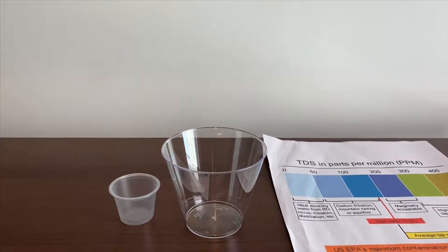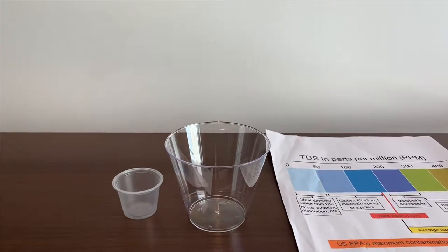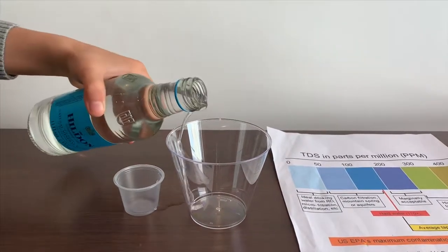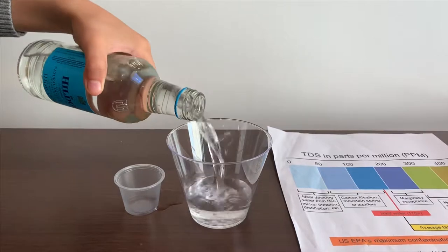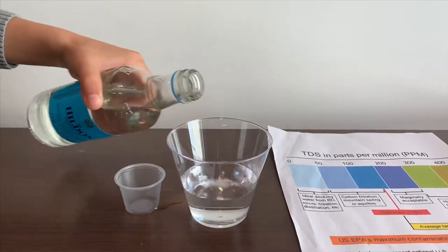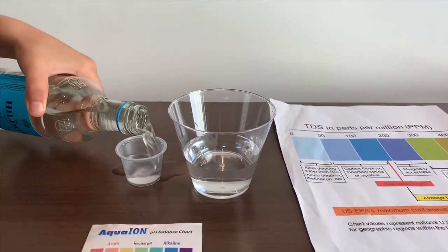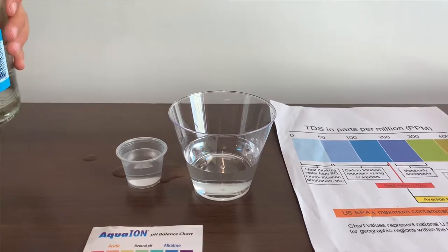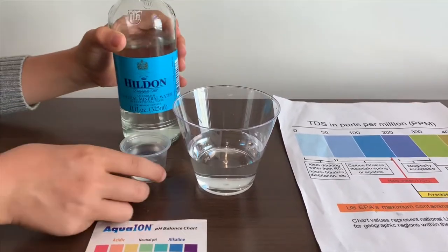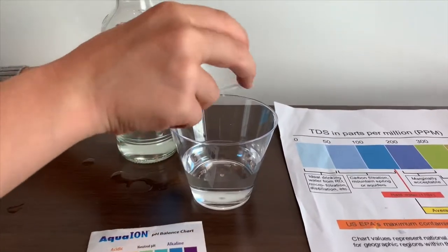Let's pour some water in. That's a little too much for the pH. Let's pour some back in the TDS.